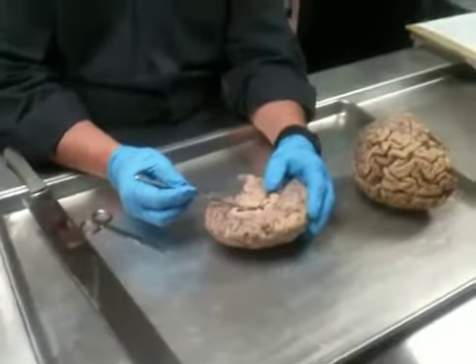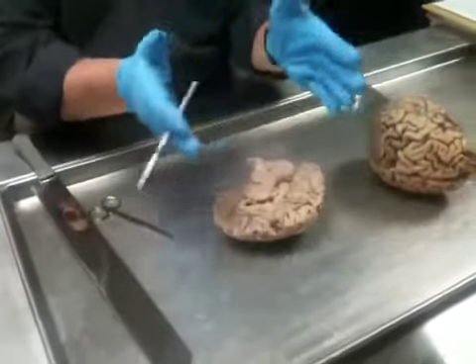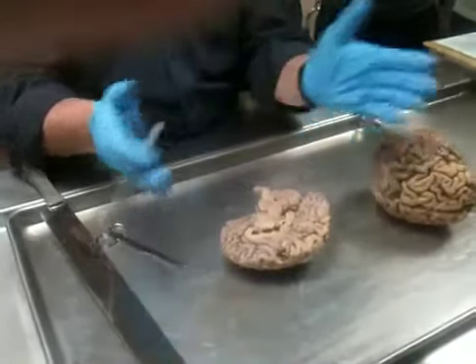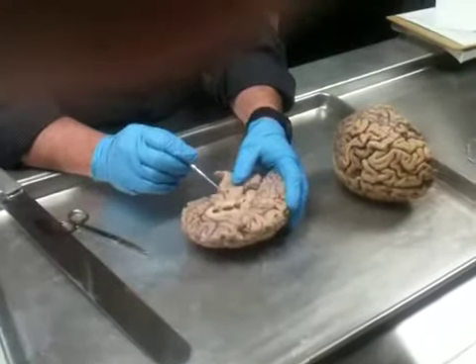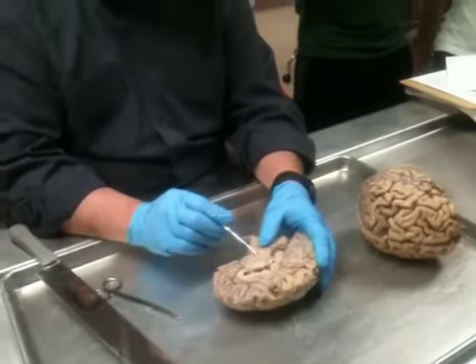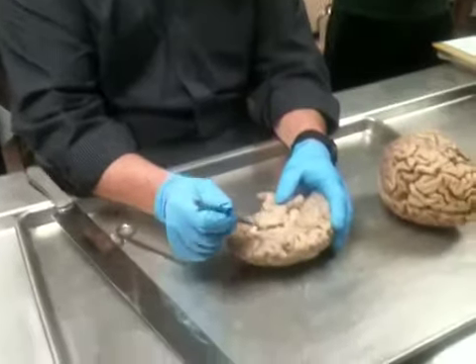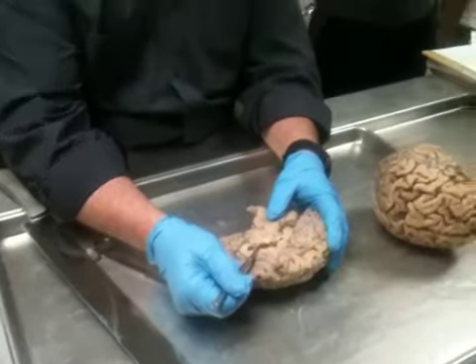And then usually this is all covered with septum pellucidum, and that just depends on how accurate I am with cutting a pure mid-sagittal section. Apparently at this point not so great. But the piece that you have to focus on is that here's the diencephalon, and as the fornix comes curving over the top, here's the interventricular foramen. So this is how CSF gets from the lateral ventricle into the third ventricle.